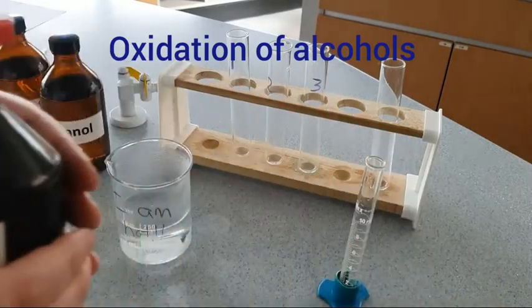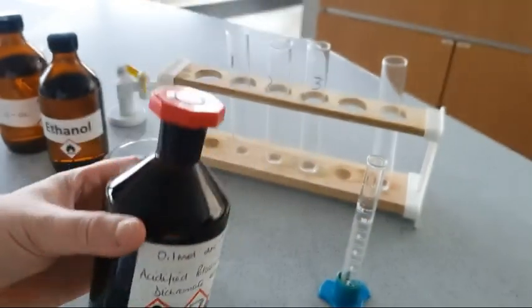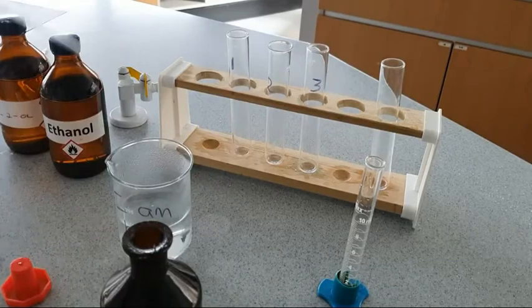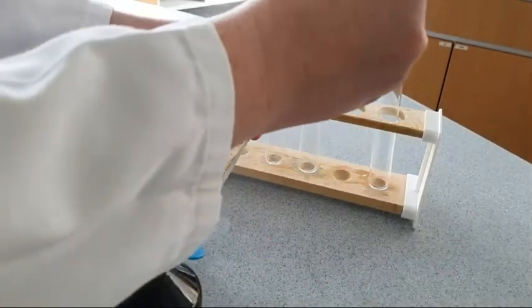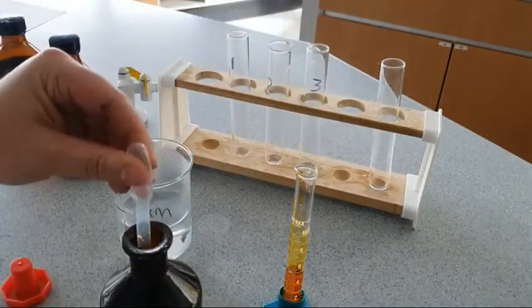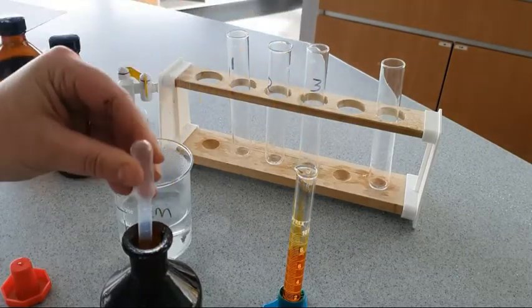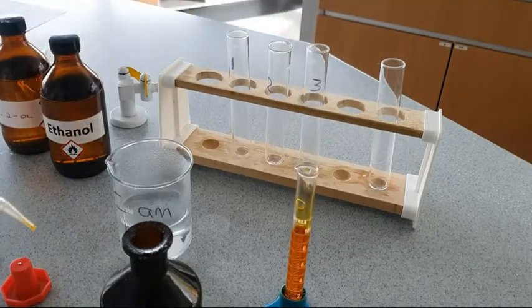In this video we are going to look at the oxidation of alcohols. You remember that the oxidizing agent for alcohols is acidified potassium dichromate. Acidified potassium dichromate is an orange solution which, when it oxidizes an alcohol, is itself reduced to give chromium 3+, and so we should, if oxidation occurs, see a colour change from orange to green.